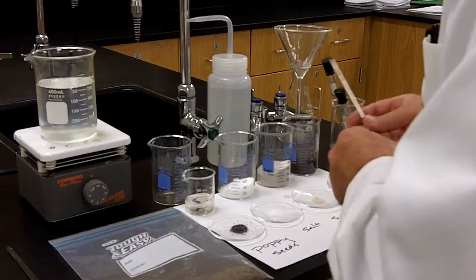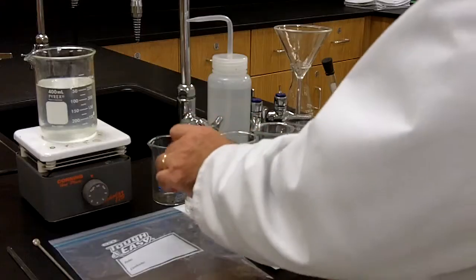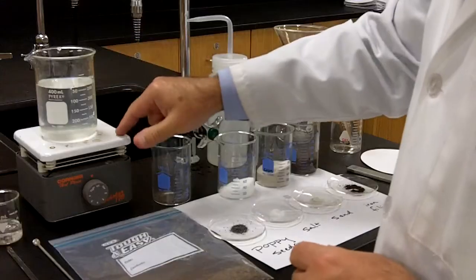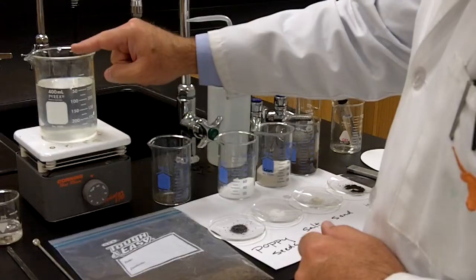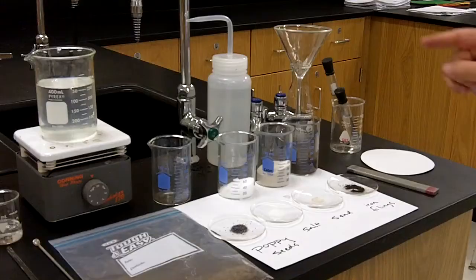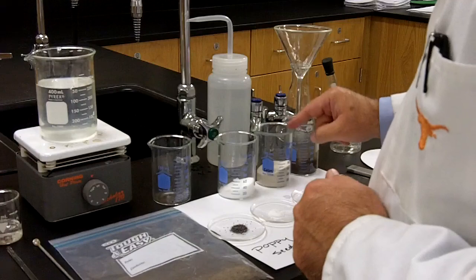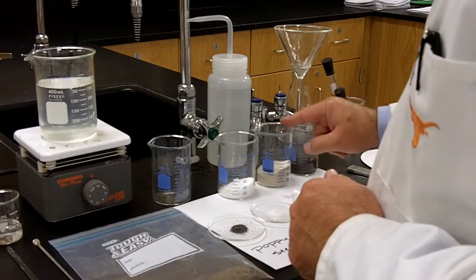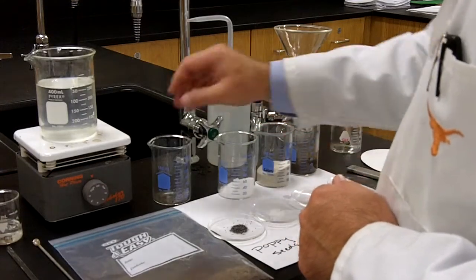Okay? The next thing is salt. And we want to be able to distinguish between salt and sand. So what I've done is a little experiment in which I have taken water and heated it. You'll have access to a Bunsen burner. Be careful, but you'll have access to a Bunsen burner, and you're going to heat up the salt water solution. Look to see if the salt dissolves. Do the same thing with sand and see if you can distinguish between a salt solution and a sand solution, or a salt mixture and a sand mixture. If you can, then you're going to be able to separate salt from sand. Okay? And that should do it for you.